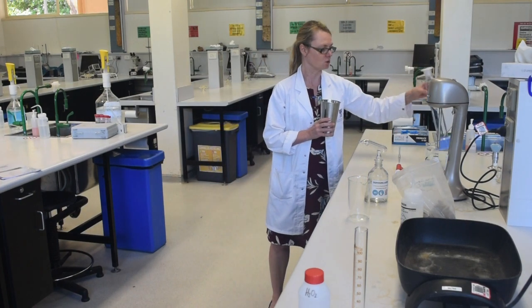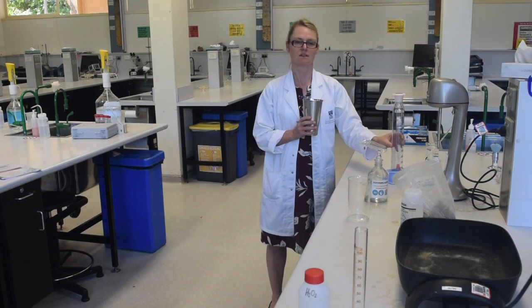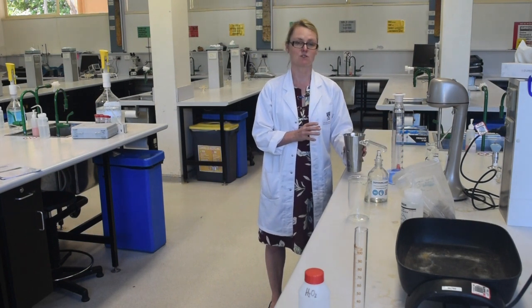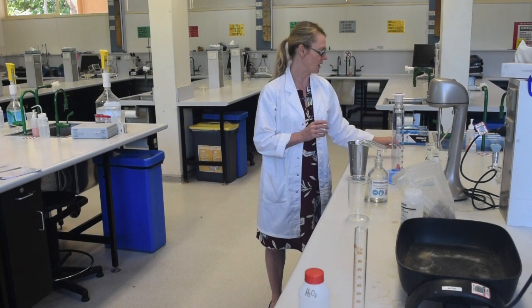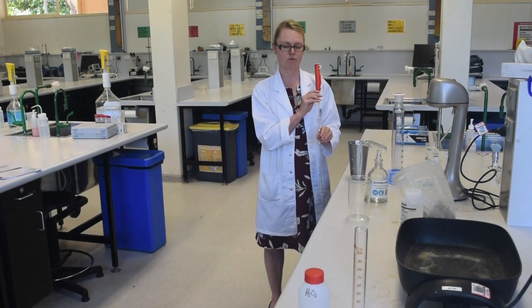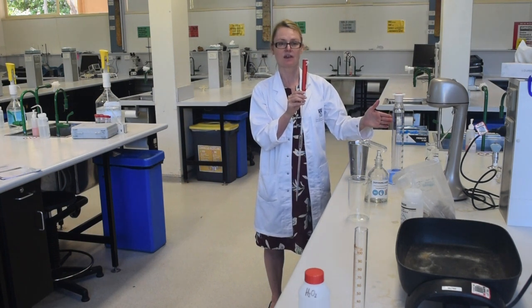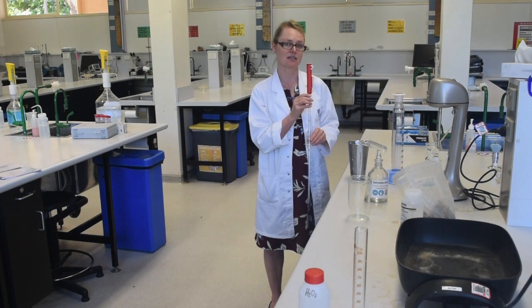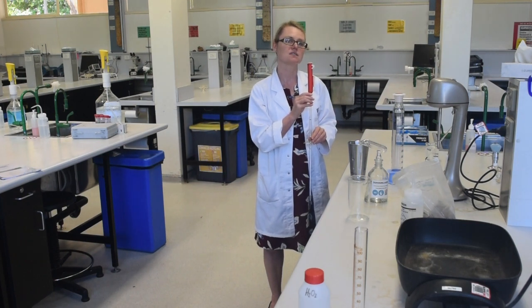Once your sample is dispersed you're ready to pour it into a measuring cylinder. It will have to be well mixed before it is placed in the cylinder, and your lab demonstrator will explain how to do that. You will then use a pipette to take a set volume of your sample from a set depth at a set time. You also have to come back the following day at a set time to take a second sample, which will then be placed in an aluminium tin and put in a drying oven.